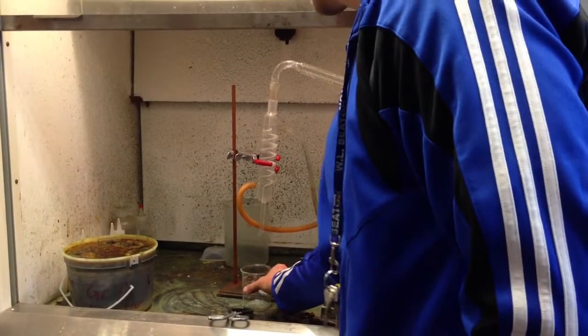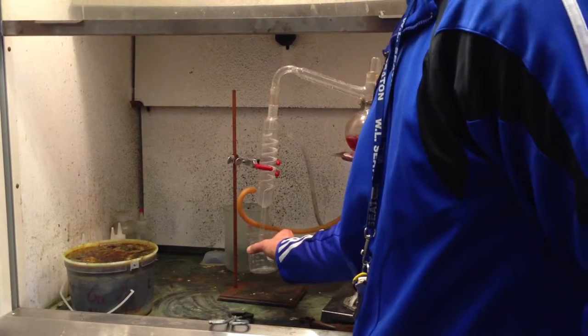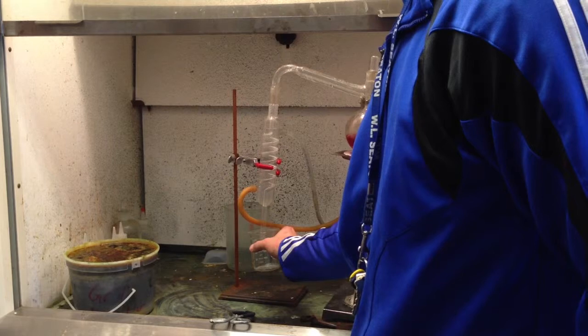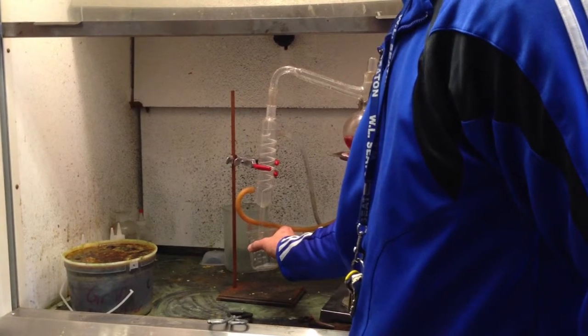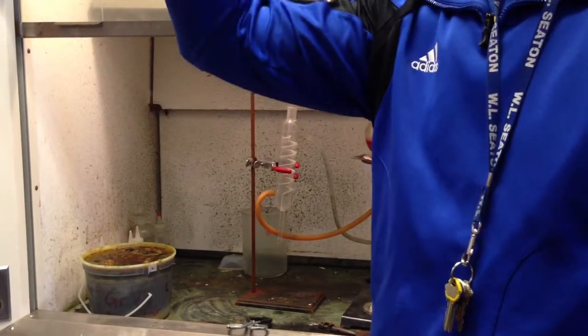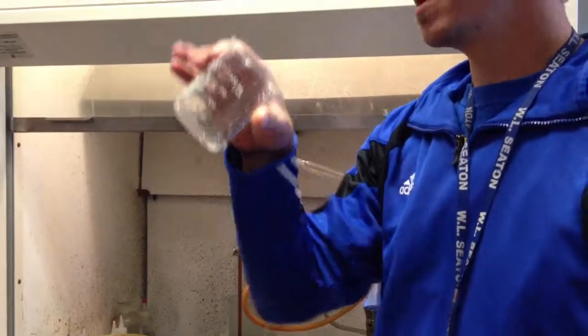And the question was, is it red still? Let's catch a few drops. And what do we have? Pure water. Pure water. Drink it.